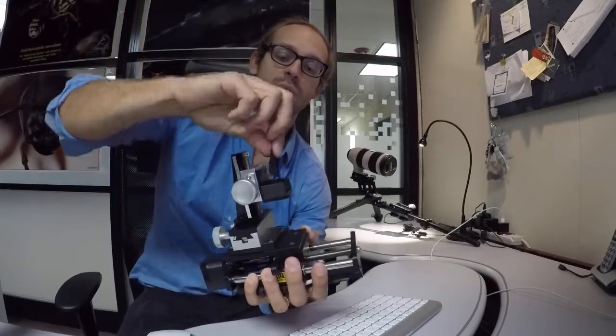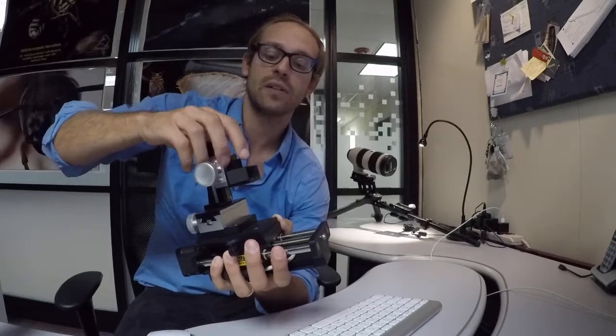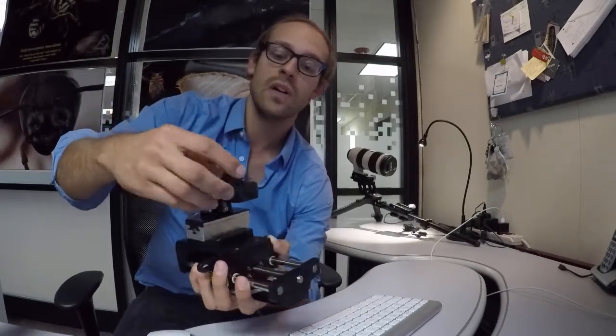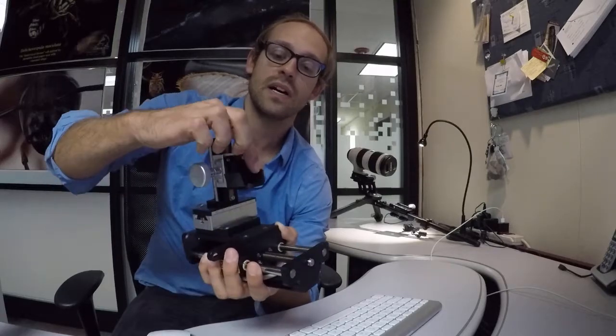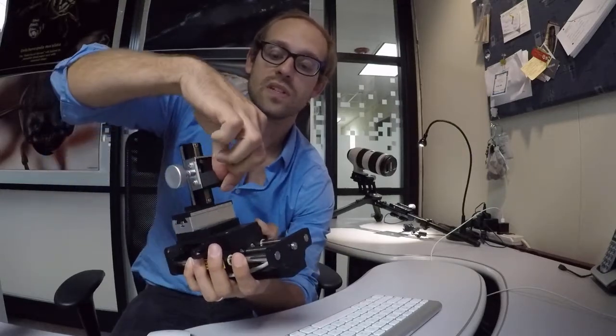I have a piece of black felt that I'm going to have on the background which really diffuses any of the background light, eliminates glare and reflections, and gives you a really pure crisp black background. I also have the foam strips sticking to either side, and that's important for light diffusion which we'll get to. This is the standard L bracket stage that we provide with these systems.